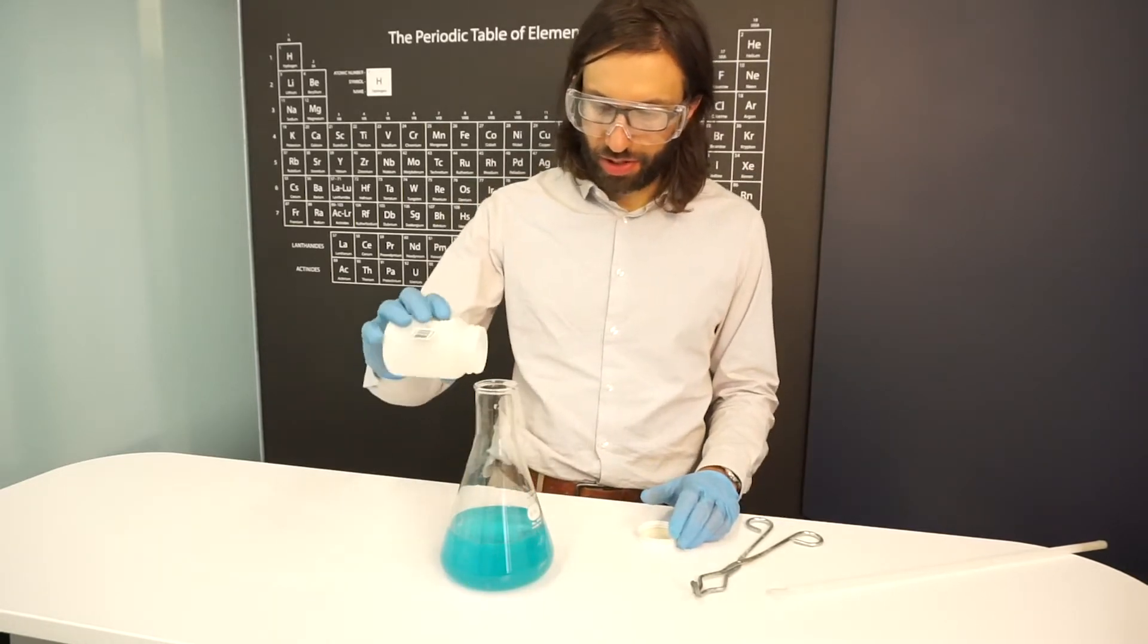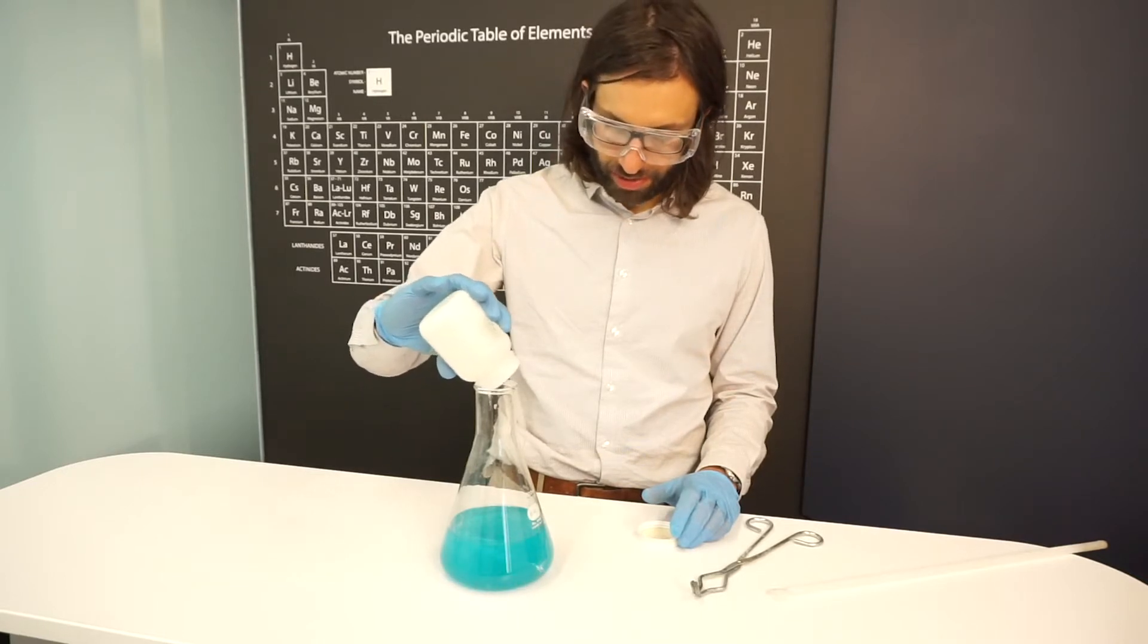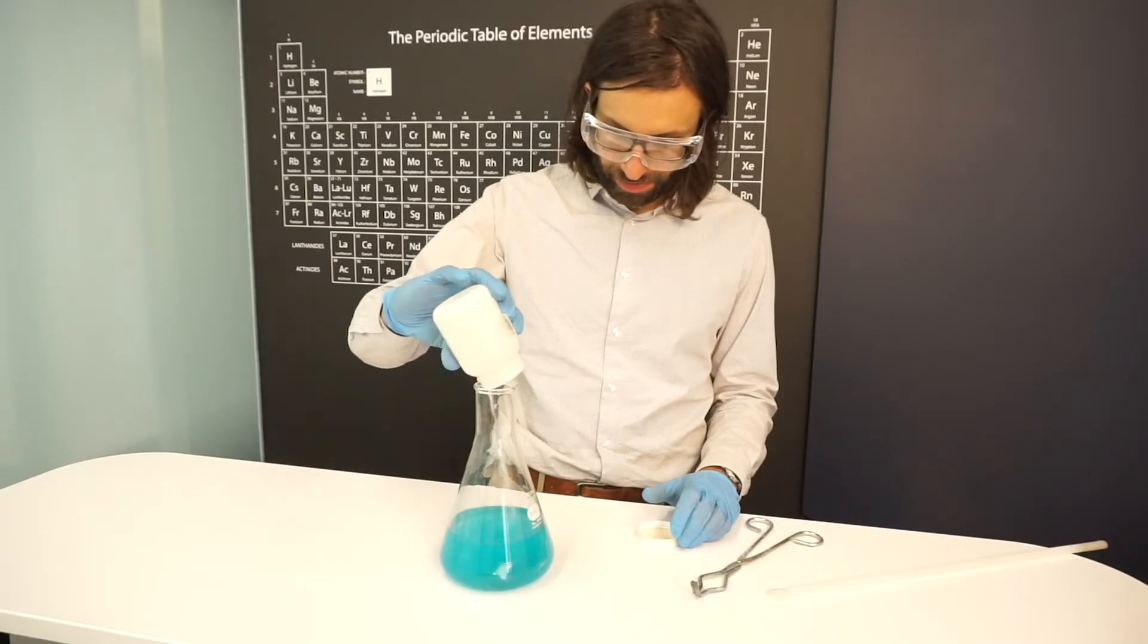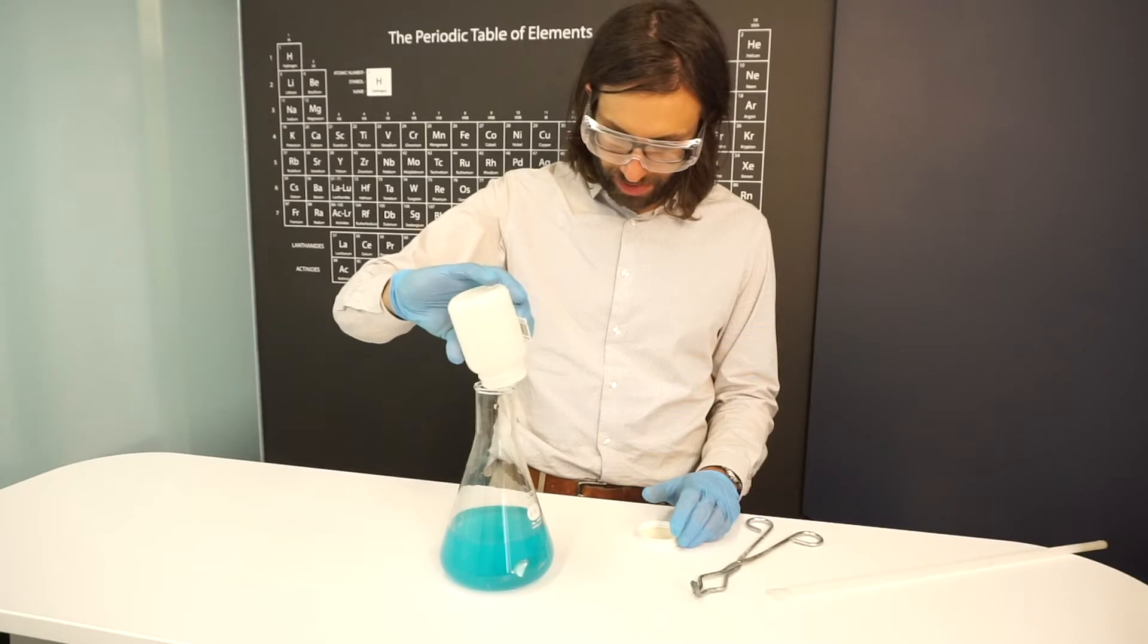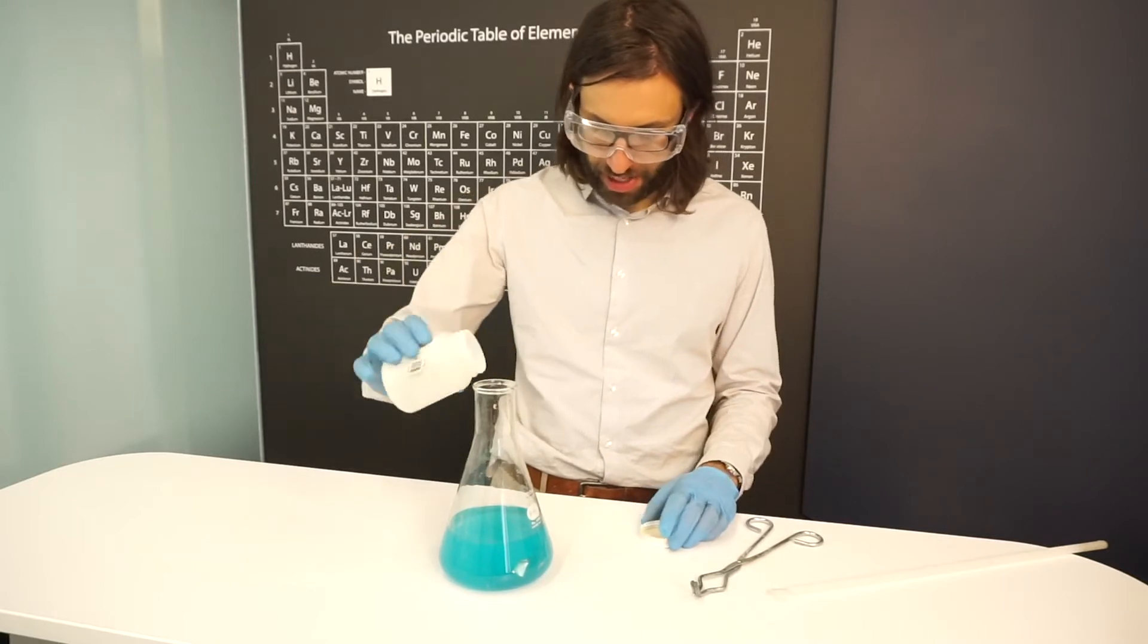Now we're going to add some sodium chloride, salt, table salt. Add that in there.